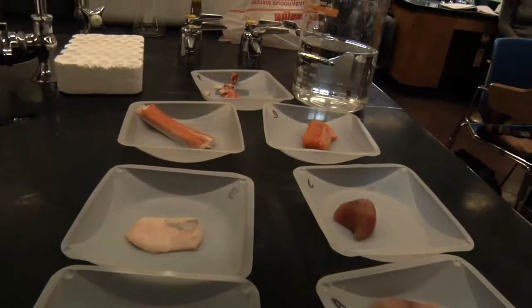Today we're concentrating on protein analysis. In this particular case, at Lucy's restaurant, somebody was either poisoned or had an allergic reaction to something they ate. It's suspected that they were using a cheaper fish in the crab meat and selling it as a crab meat dish.